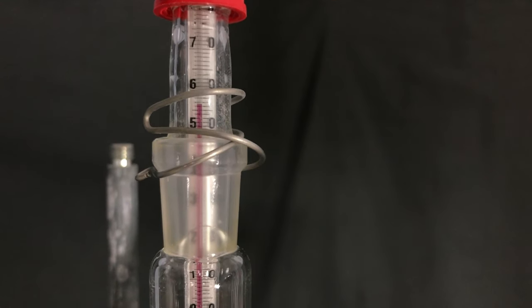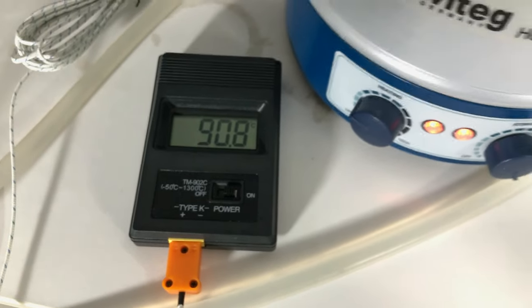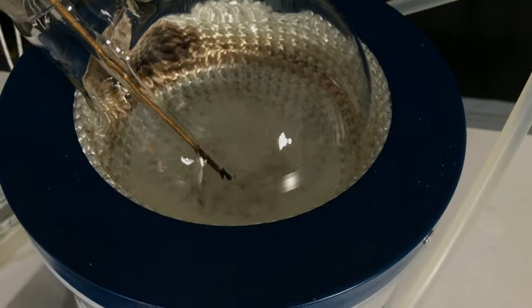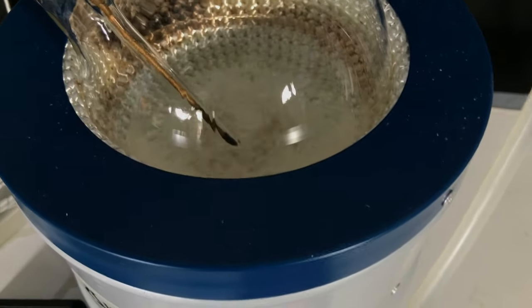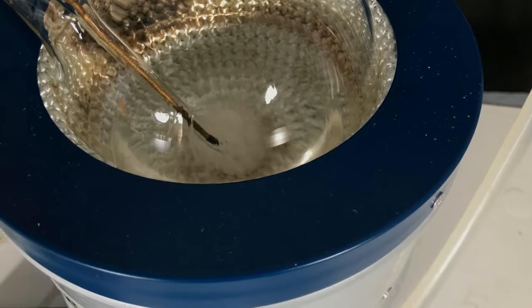At some point the temperature went above 58 degrees. The heating mantle was turned off. You can see a few chunks of unreacted boric acid floating inside of the flask.